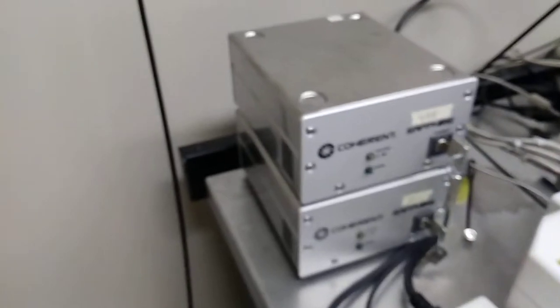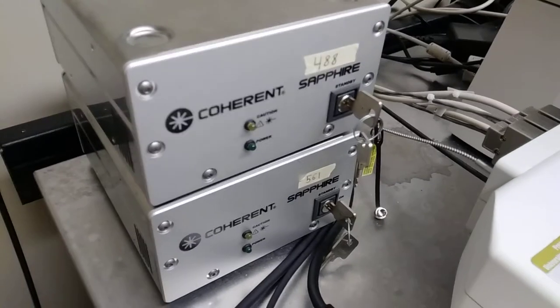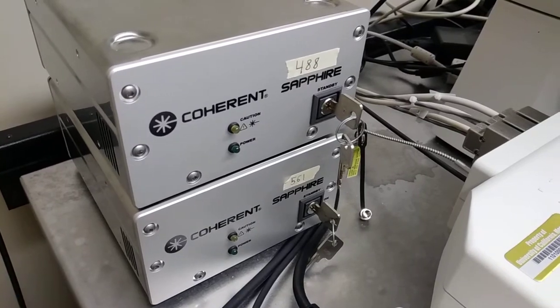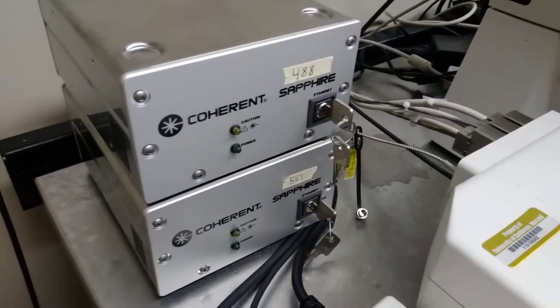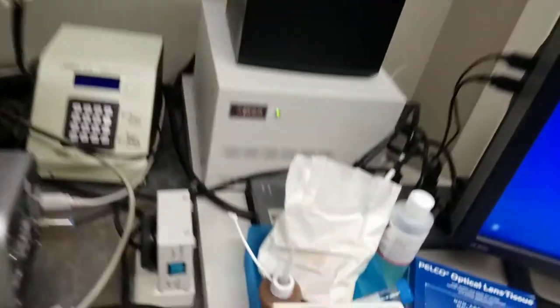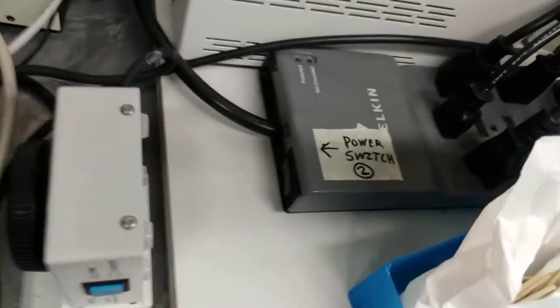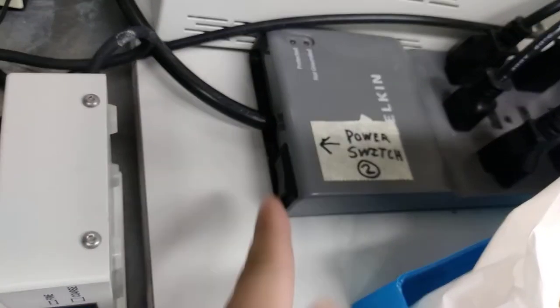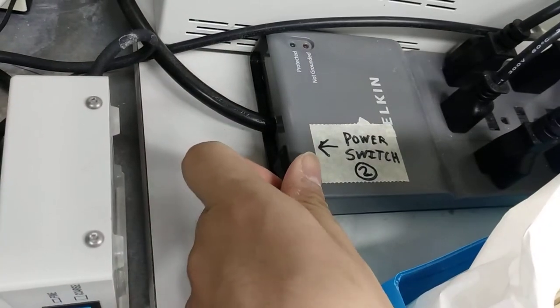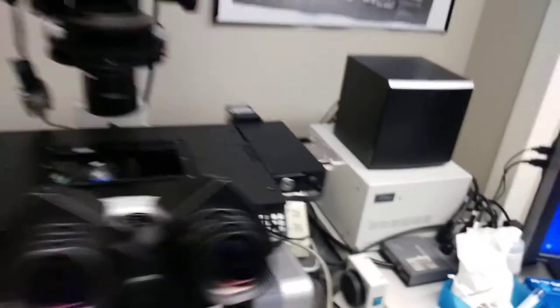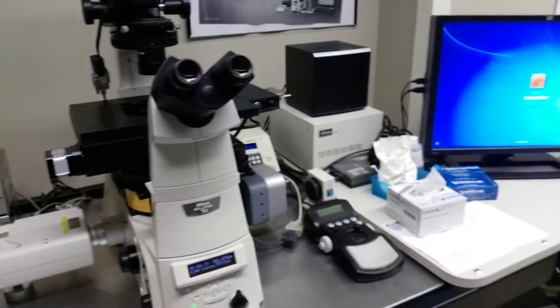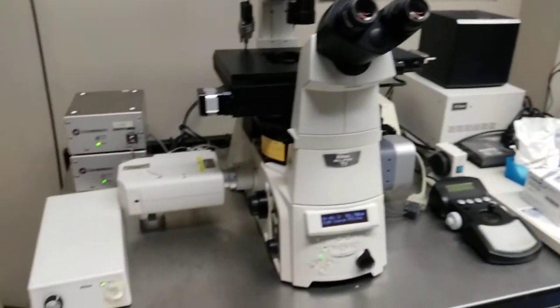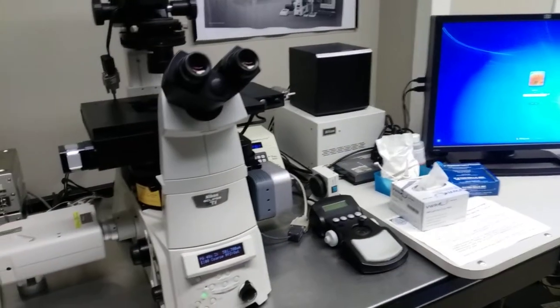Next step is to go over here to where the laser control boxes are. Just double check that they're on standby, just like that. And if so, go over here. Over to where the power switch is labeled, all you have to do is switch this on. What will happen is the components of the microscope will turn on. So you have your microscope, your stage controller, your shutter controller, the lasers, and so on.